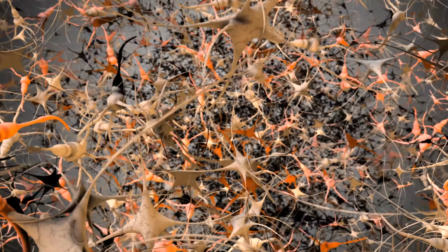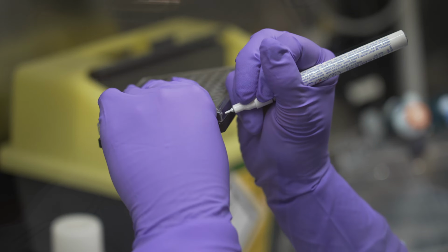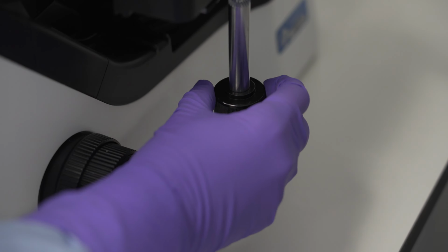One of our focus areas at Medicines Discovery Catapult is neuroscience, where there's a significant unmet need across the whole spectrum of CNS disorders. At MDC, we're using a range of human stem cell central nervous system models to model disease, with the goal of producing predictive models with better translation to the clinic. We have a number of technologies that can assay cell profile and cell behaviour.